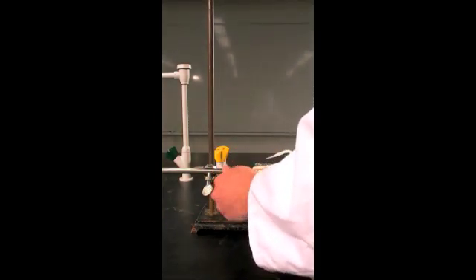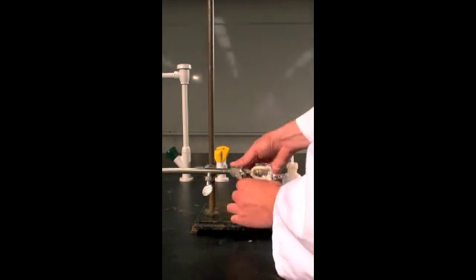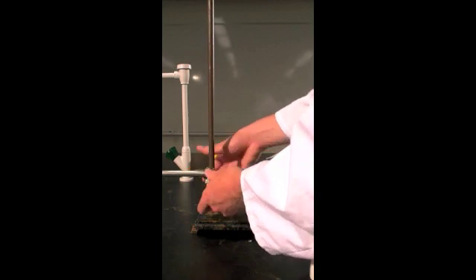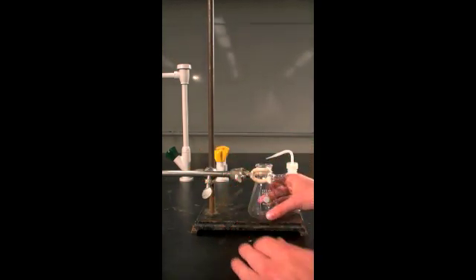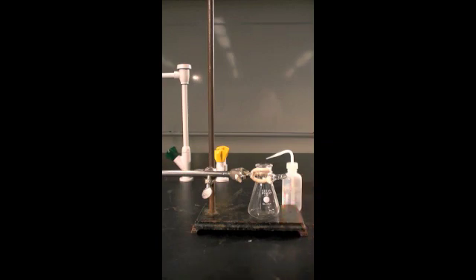Make sure that the clamp doesn't tighten over the sidearm or the little nipple-like protrusion coming out. This will prevent it from breaking. Then lower the clamp so that your flask is sitting on your retort stand.